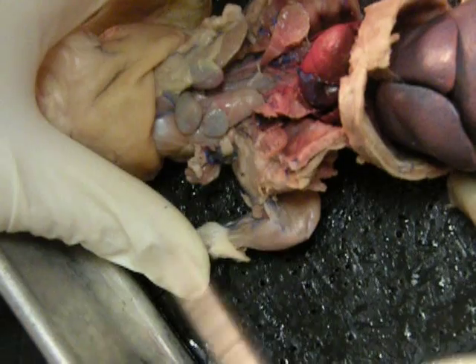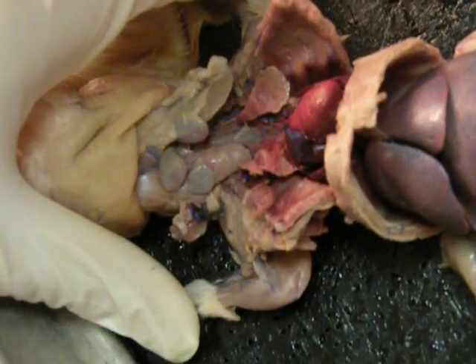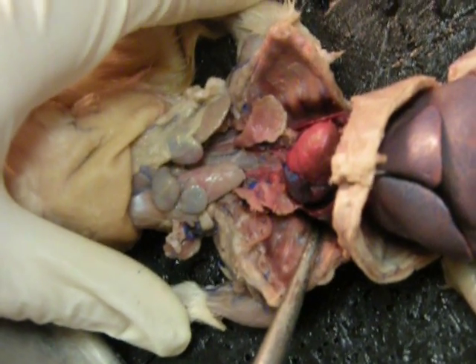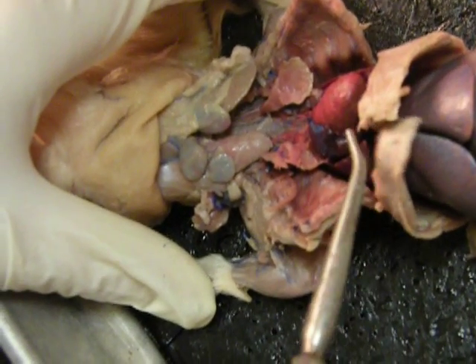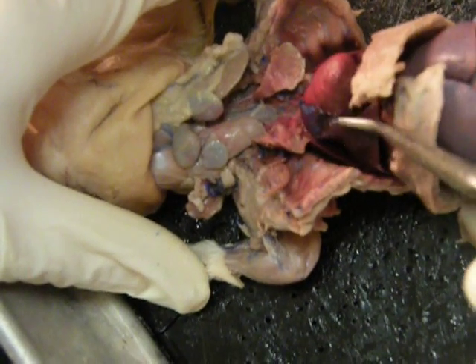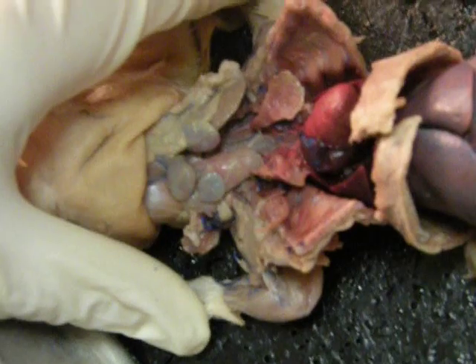It was kind of like a bubble. There might be some remnants of it on the sides, but it's kind of hard to see. You also have your pleura — so you have your visceral pleura and your parietal pleura, and that has to do with the lungs. On top of the lungs, this shiny stuff will be your visceral pleura, as opposed to your parietal pleura, which might be attached to some of the sides, just hard to see.